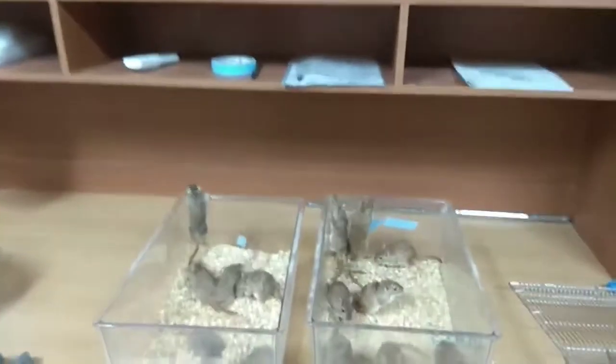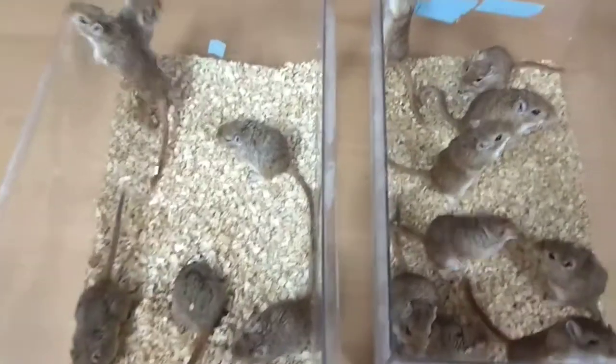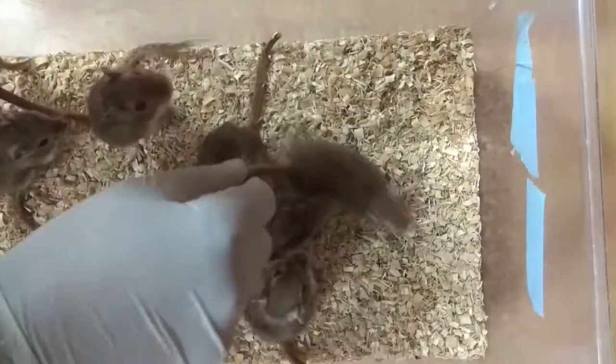So let's see — here I have already taken two cages of gerbil. These gerbils are male gerbils, and I am going to show you how we can differentiate male and female gerbil.